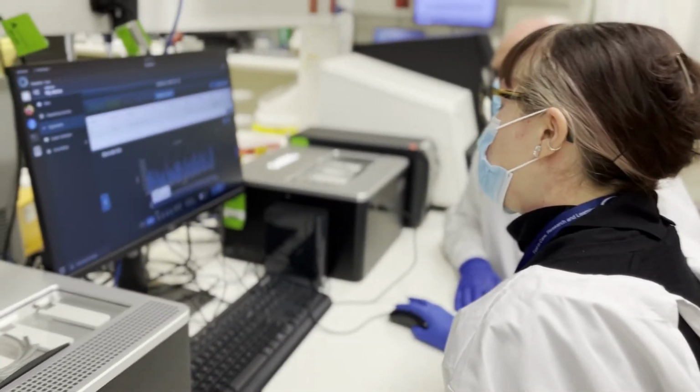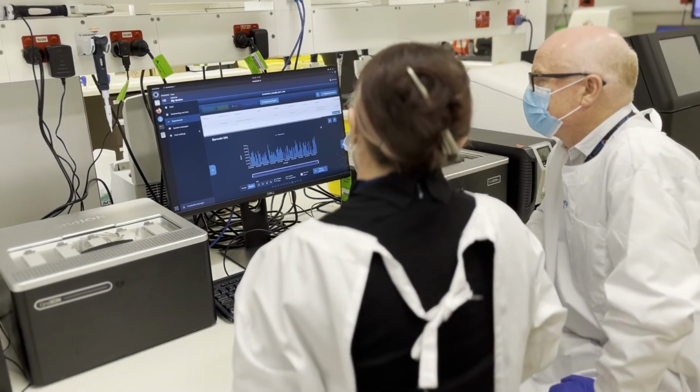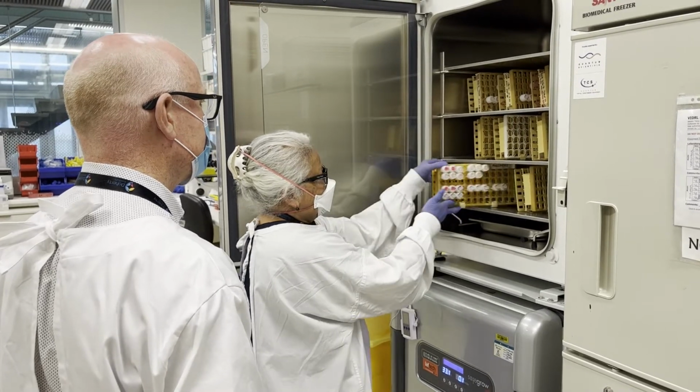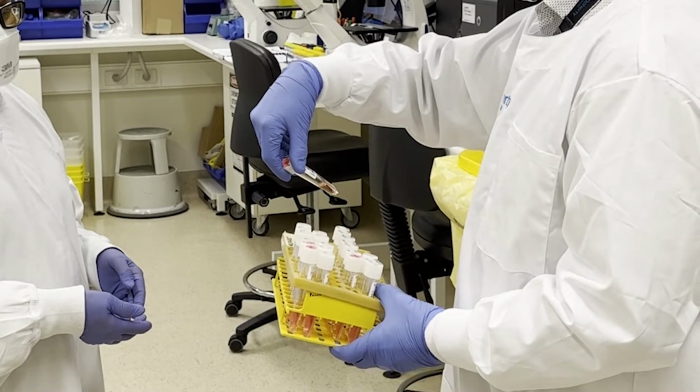And that's what we now want to do with enteroviruses, to sequence the whole genome and make comparisons in areas that we haven't looked at routinely before in a diagnostic setting. And we think that this information will be very useful for our understanding of enterovirus infections.